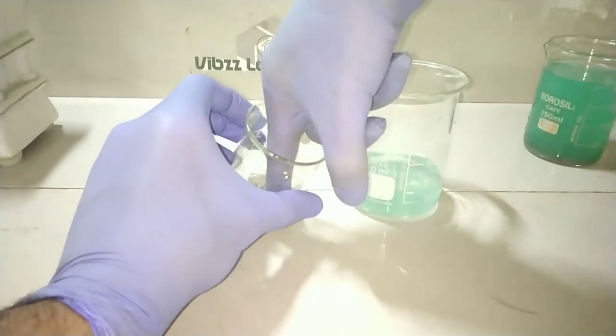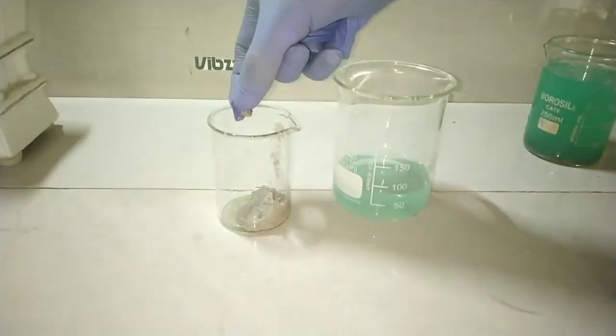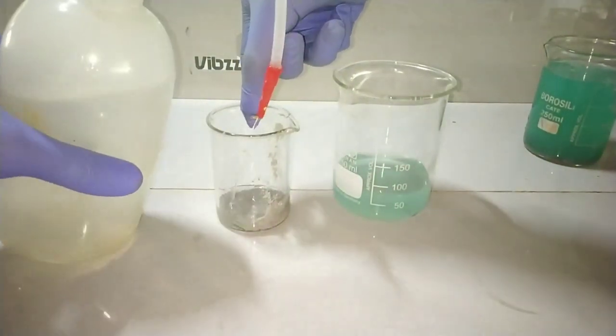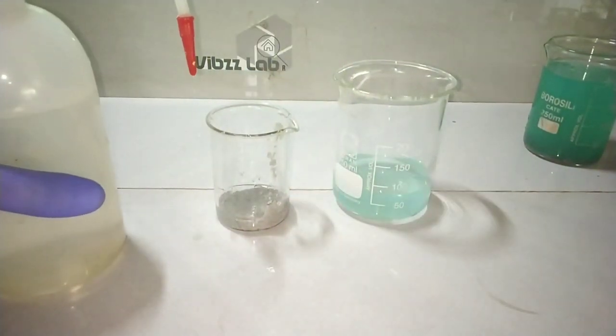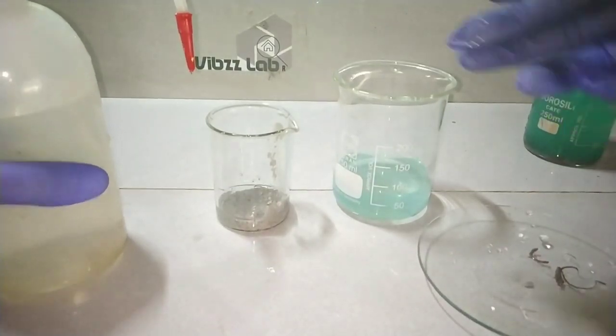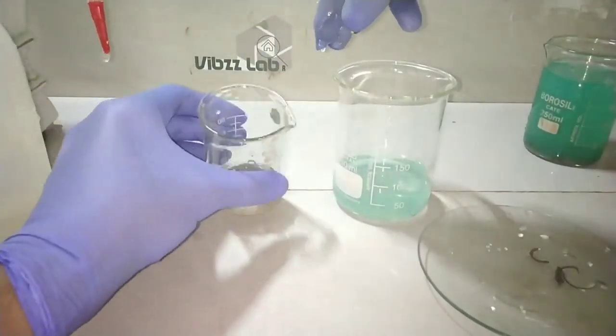Now I will remove all the unreacted copper metal. I should take care to wash off the silver precipitate which is stuck on to this copper metal before removing them.